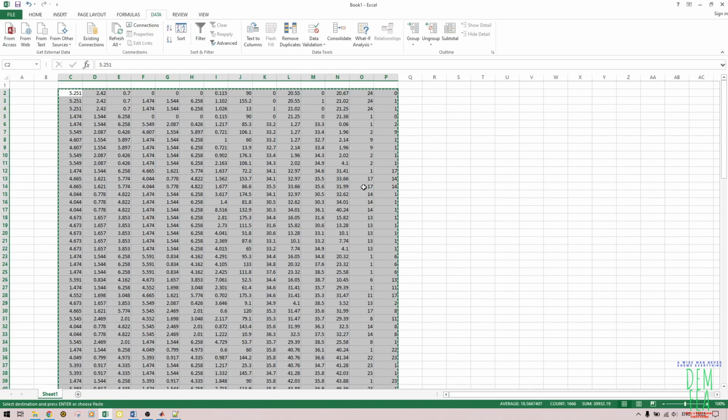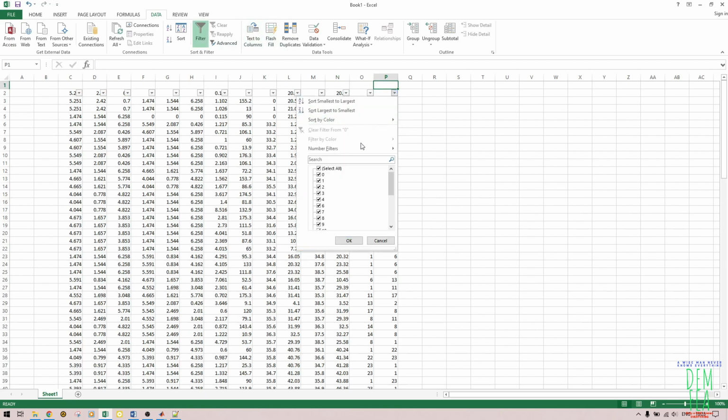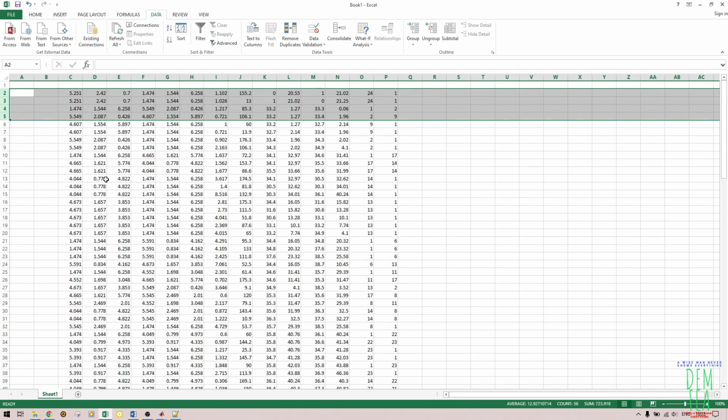So what you do, you just come here, escape, then you filter. That is what I usually do. So I filter like that, and then, oh sorry, let me remove filter. I filter from here. So this is what I do. I just come here, select like that, and then after doing that, as you can see, I've only filtered those two. I do this and that, and then I right click, and then I delete rows like that.